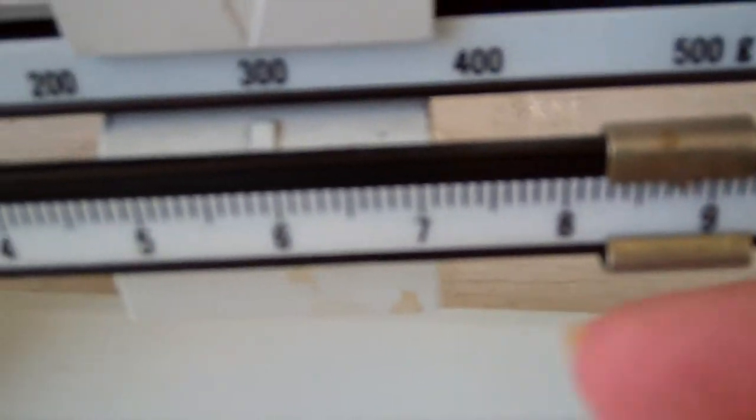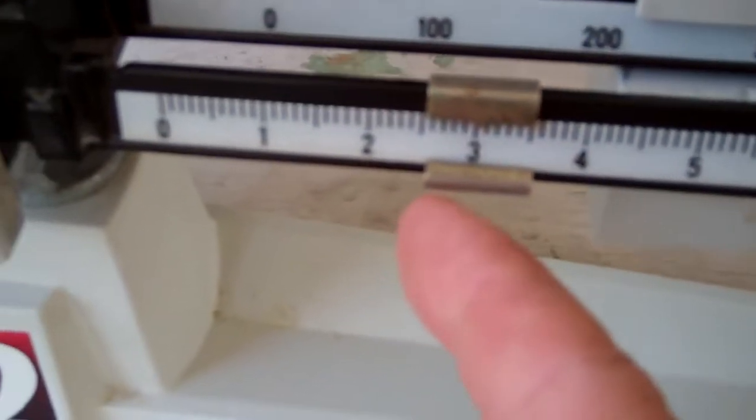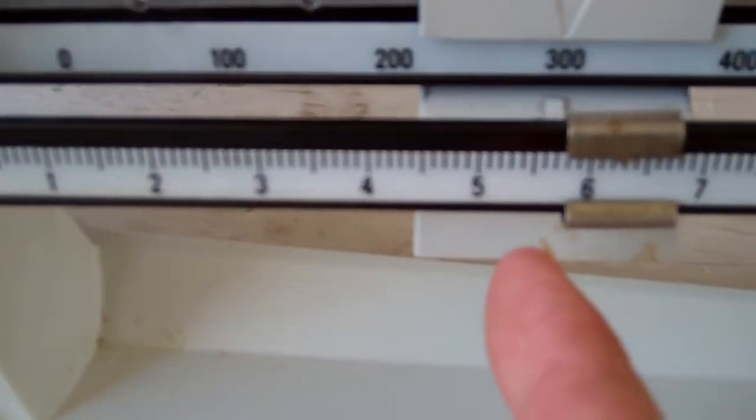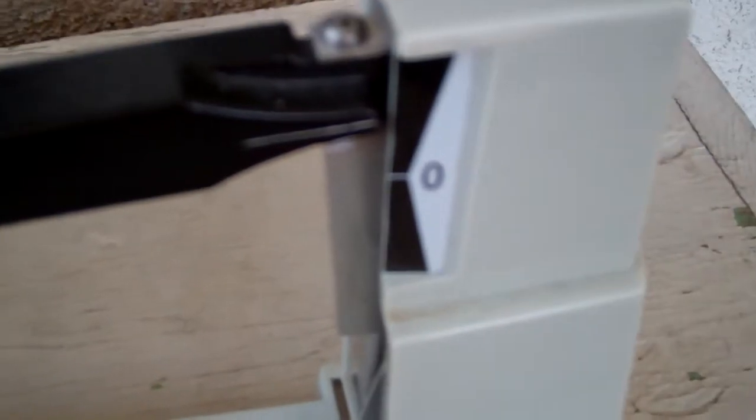Now we come to this one up here in front. So you gotta move this one around. You gotta move this one around. Until you find that line lines up.